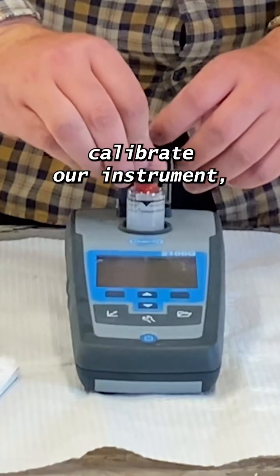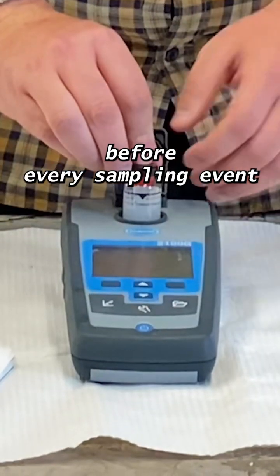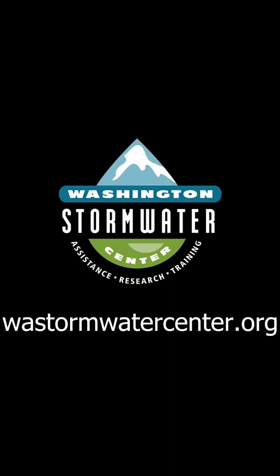We also want to calibrate our instrument following our manufacturer's instructions before every sampling event to ensure accurate results. For more stormwater tips and tricks, please visit wastormwatercenter.org.